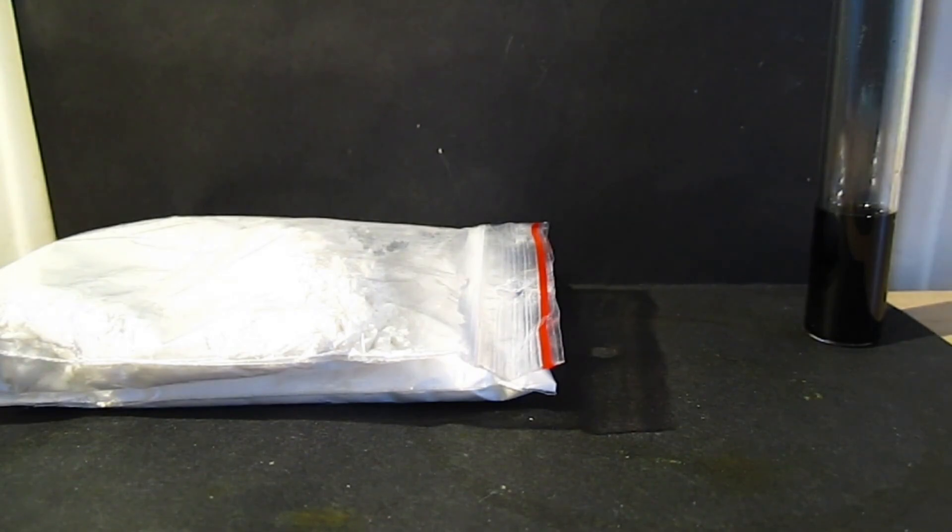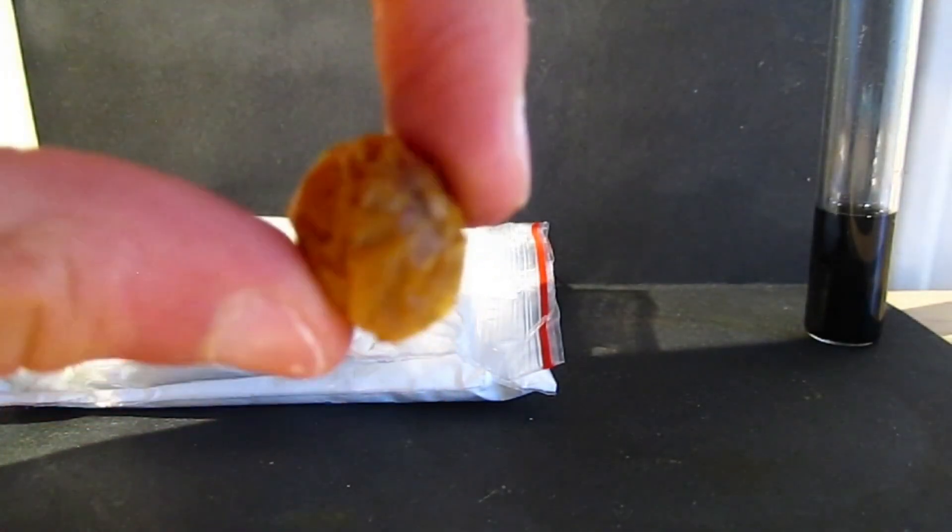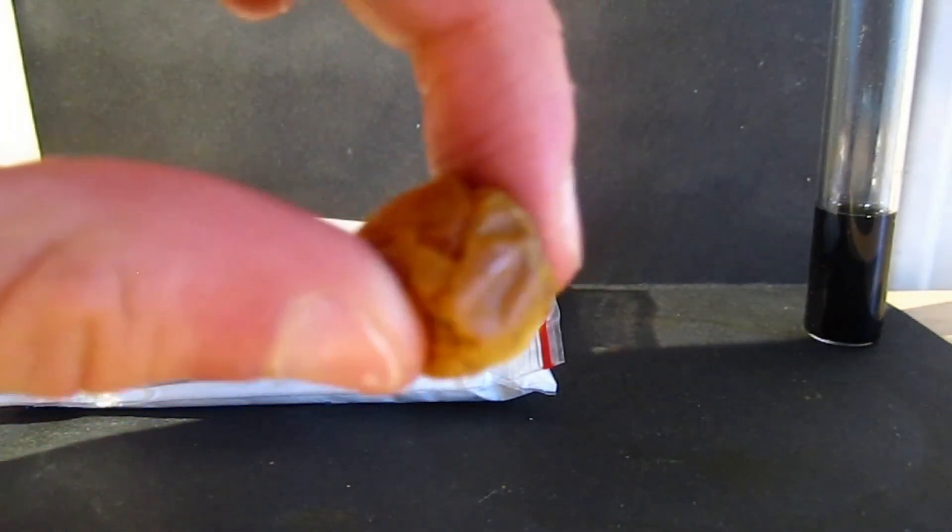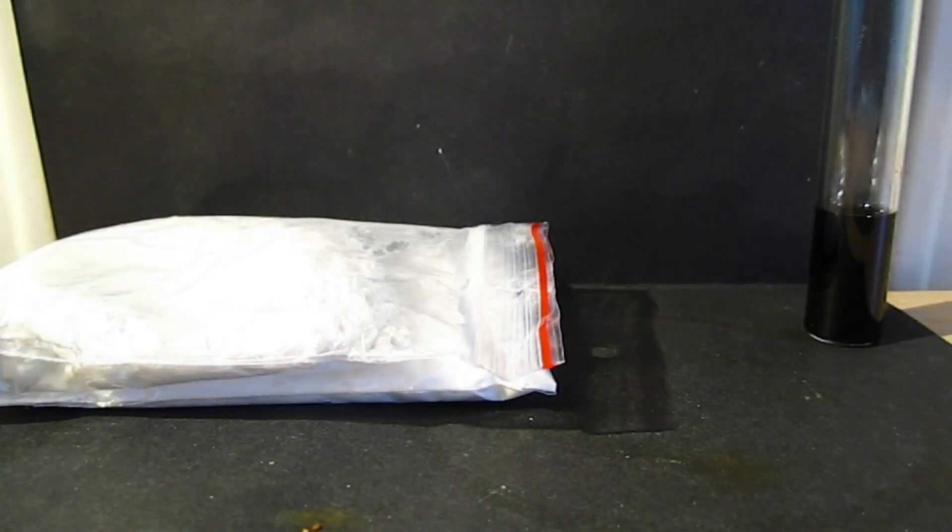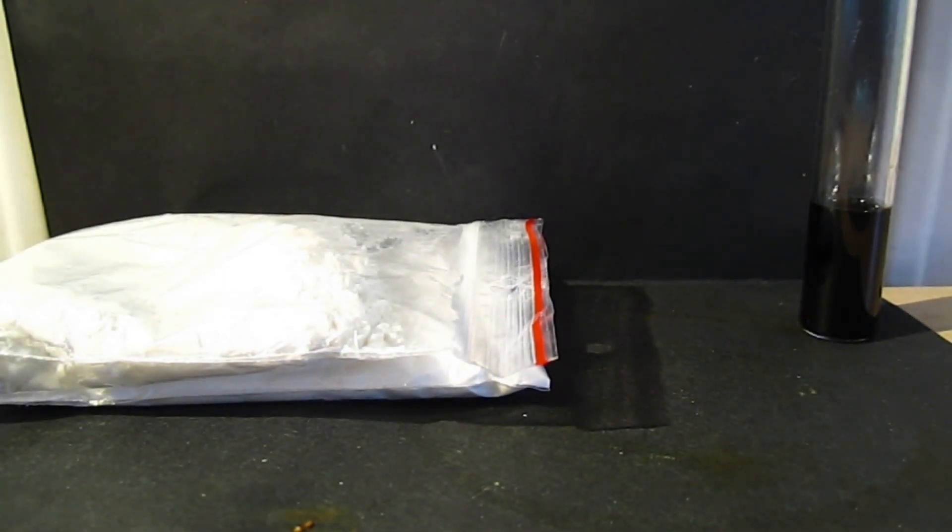Although I have found some actual oak galls which I'm going to show you right now. They're kind of these balls. And if you're grossed out by bugs that sometimes are still inside when you collect the gall apples, well, you can just buy it, but I think it's pretty fun extracting gallic acid from gall apples.